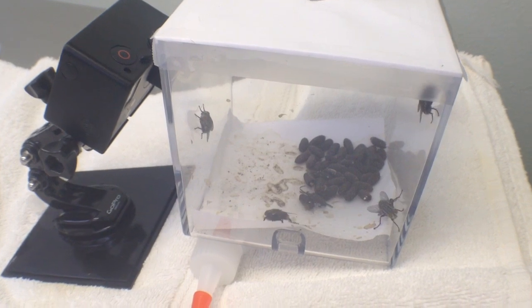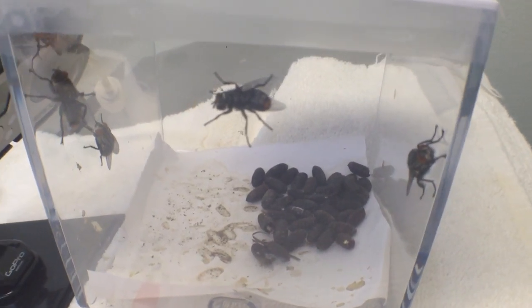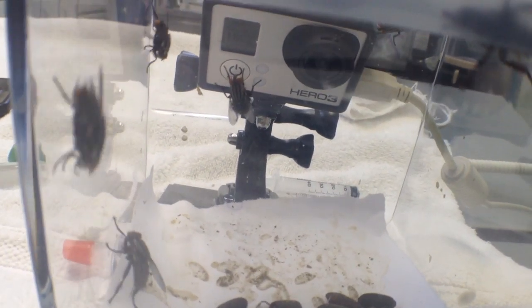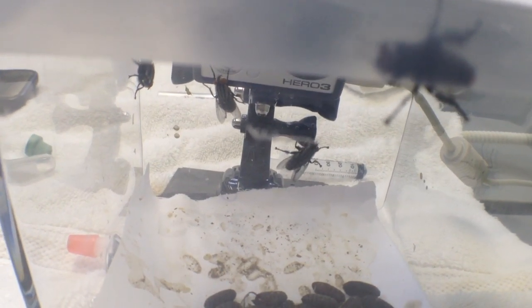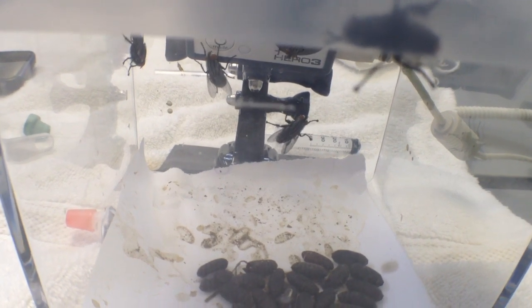After over a week of waiting, it looks like my experiment has paid off. Now we can identify the flies that are causing the problems in these turtles. I'm going to try and catch a few of these in some small plastic jars, get them identified by some entomologists, and then decide whether or not I want to fulfill Koch's postulates.